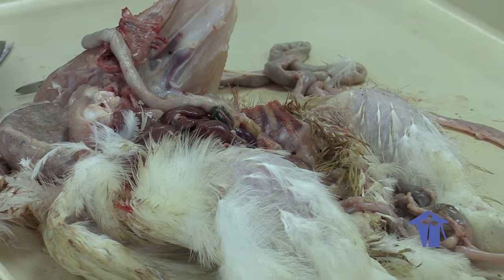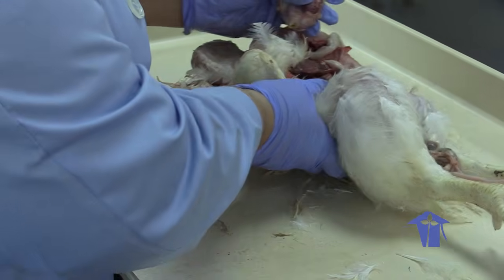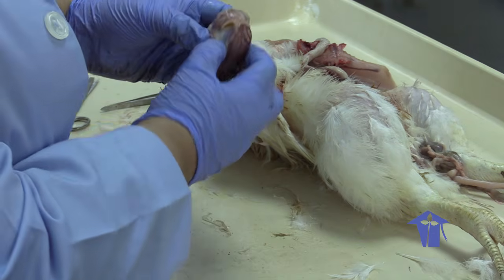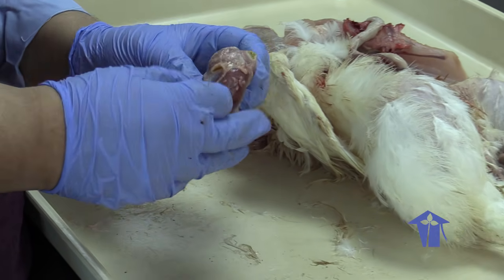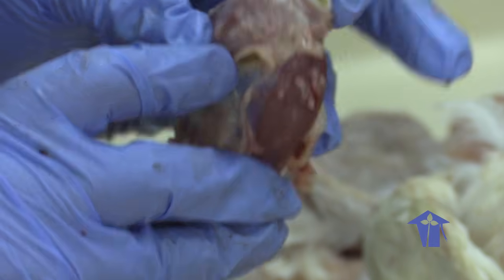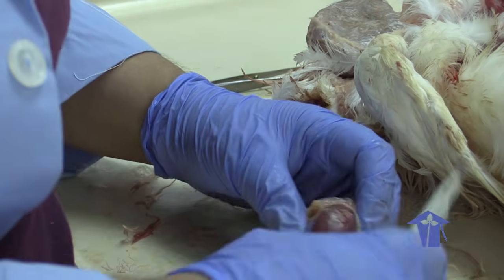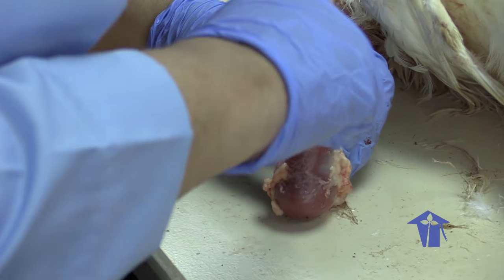You can help me open the scalpel, please. Right. So I'm going to move the carcass aside and we're going to focus on this gizzard a little. So you see how hard this gizzard is, right? And you know, gizzard is something that has to cook down for a while in order for it to be edible. That's because it has a massive amount of muscle. We have a tube leading in, a tube leading out. So I'm going to use my trusty scalpel and cut into the gizzard.